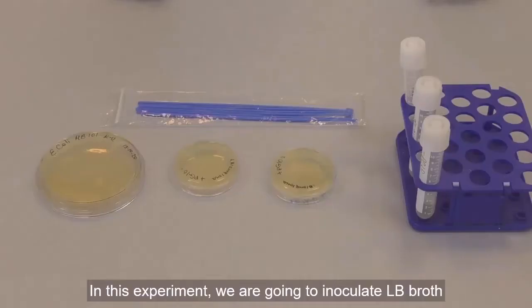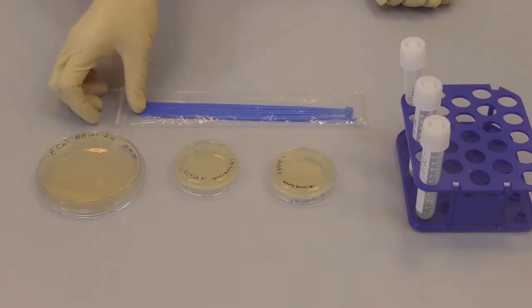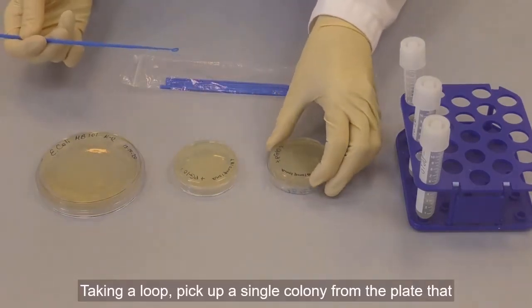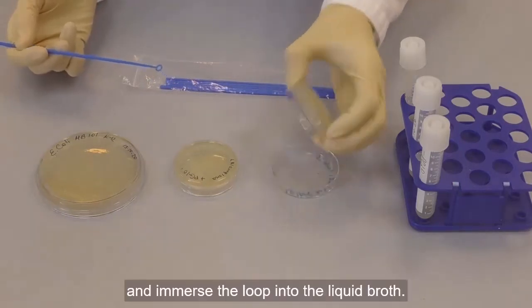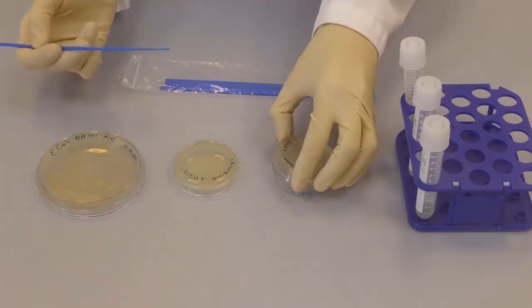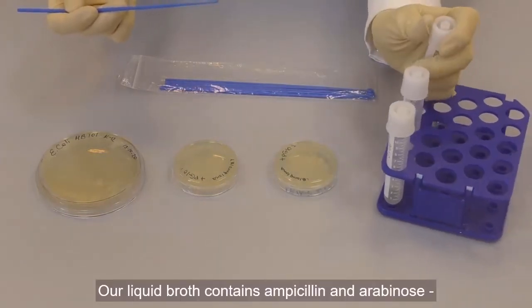We proceed with the experiment and we are going to inoculate LB broth medium with a single colony of transformed bacteria. To do so, you need the inoculation loop. Pick up a single colony that contains transformed bacteria. Do not dip it into the agar, just touch it softly. Then transfer to the tube and make sure that you mix it well.